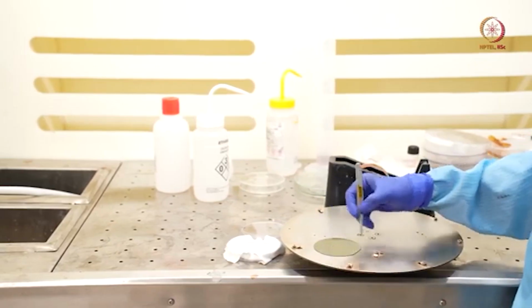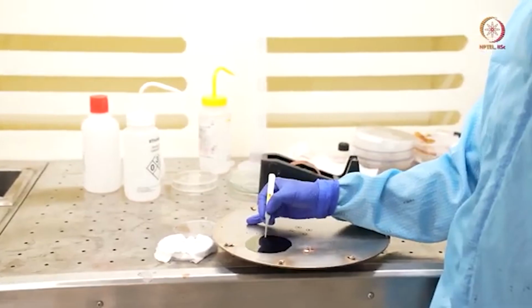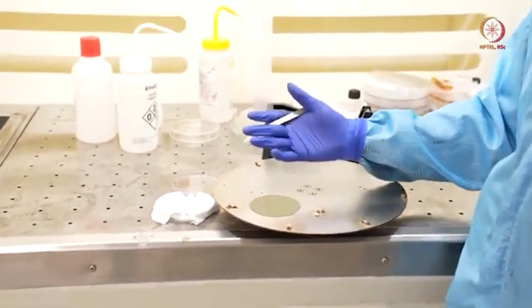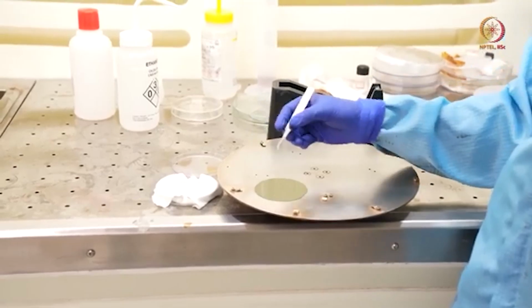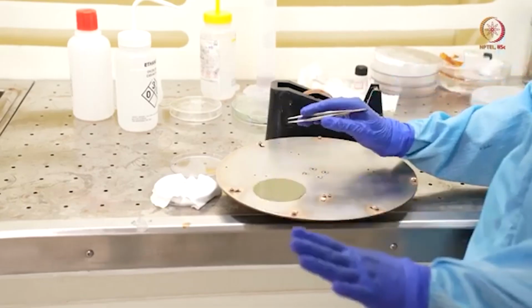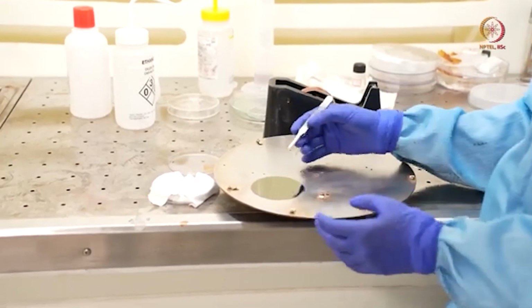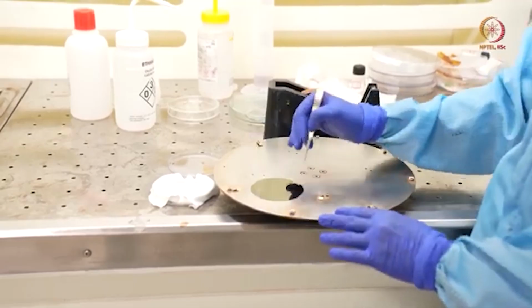If we load it, here you can see the top material is also polyimide, and if we put some Kapton tape on this, there is a sticky material, that is our gum, so it can peel the whole layer. So we have to fix this polyimide layer first on the back side, and based on that we have to load the things. We'll take some time to load it. After that we'll come back again and show you how it is fixed on this.